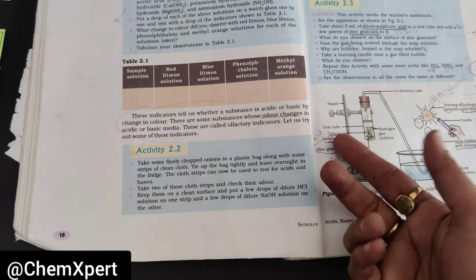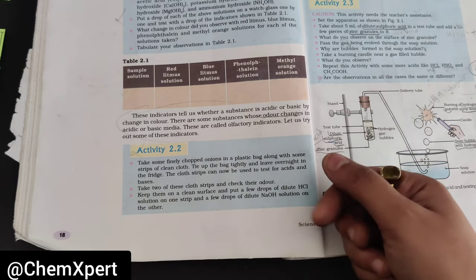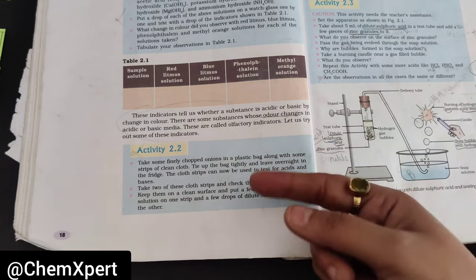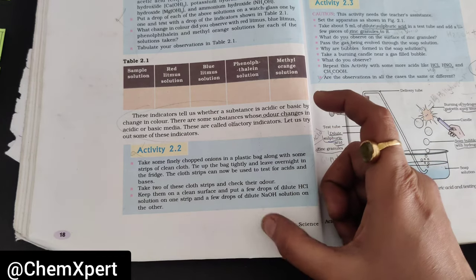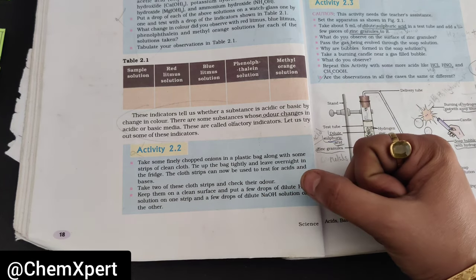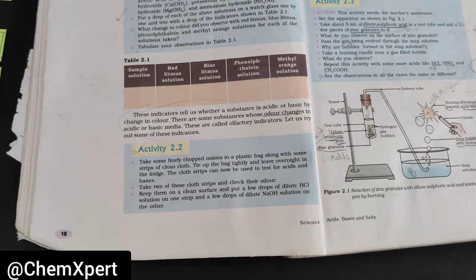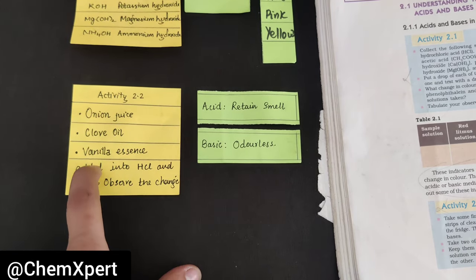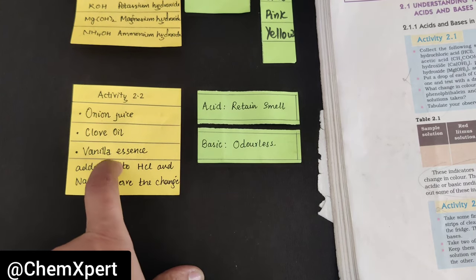Next day, the cloth will smell of onion or clove oil. When you add acid on the cloth it retains the smell; when you add base it becomes odorless. The conclusion is: olfactory indicators retain their smell in acid but become odorless in basic solution — whether it is onion juice, clove oil, or vanilla essence.